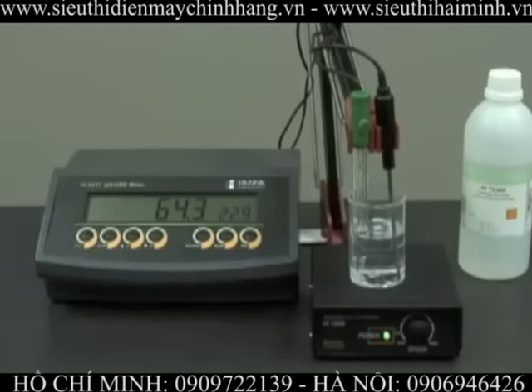At the moment, we're conditioning our electrode in storage solution. We recommend at least two hours. If you do not have any storage solution, you can use any one of our buffers. Now we're ready to calibrate.